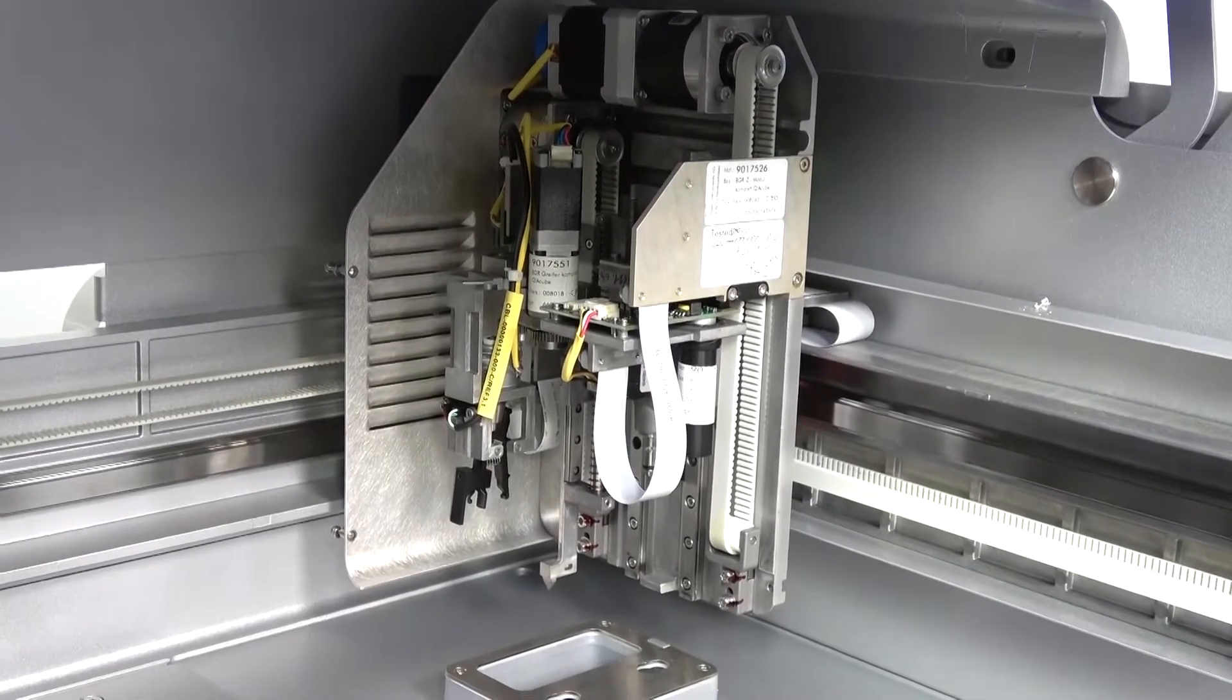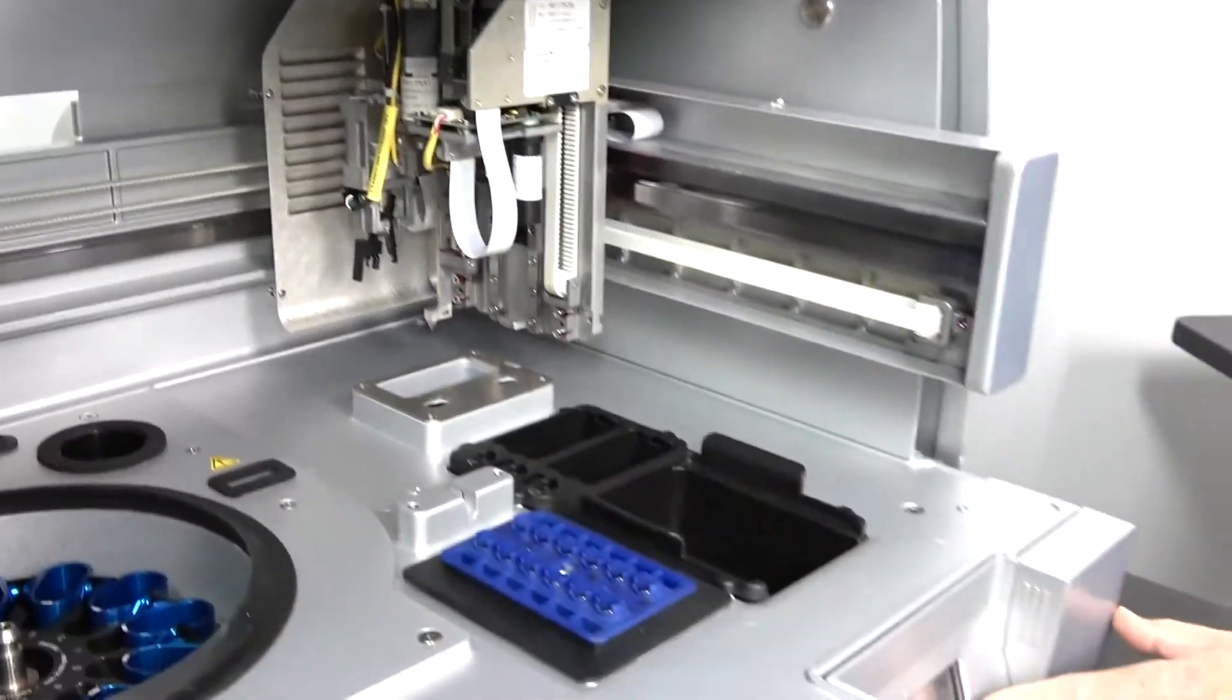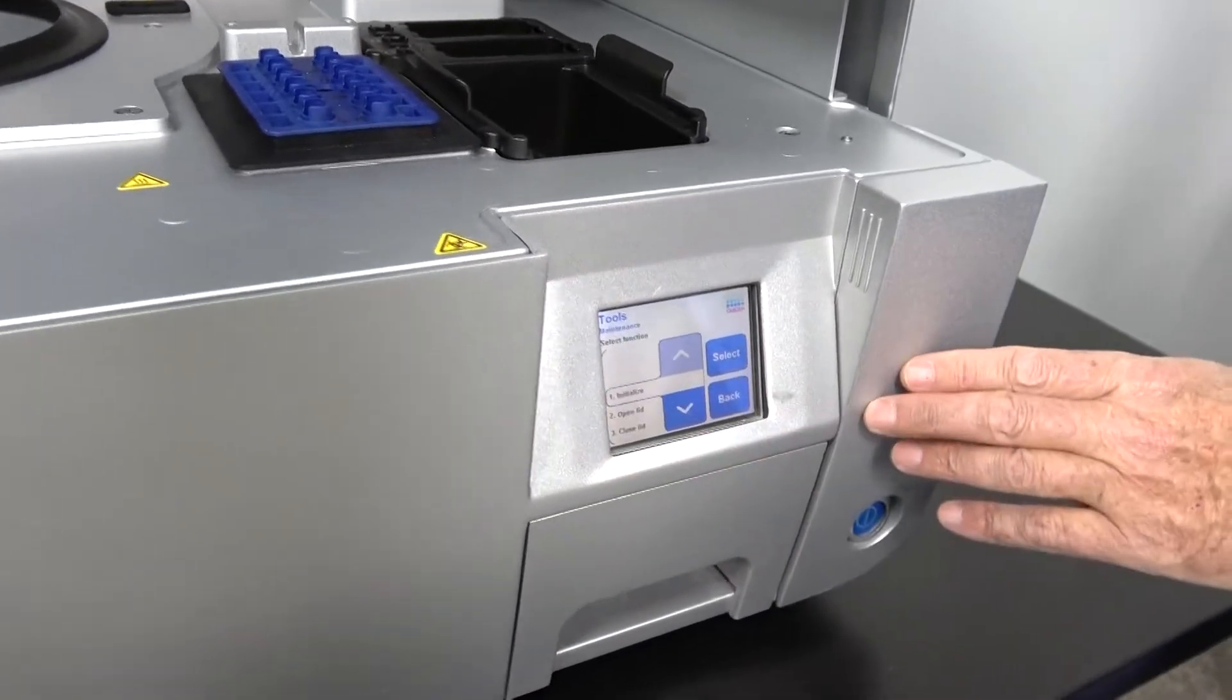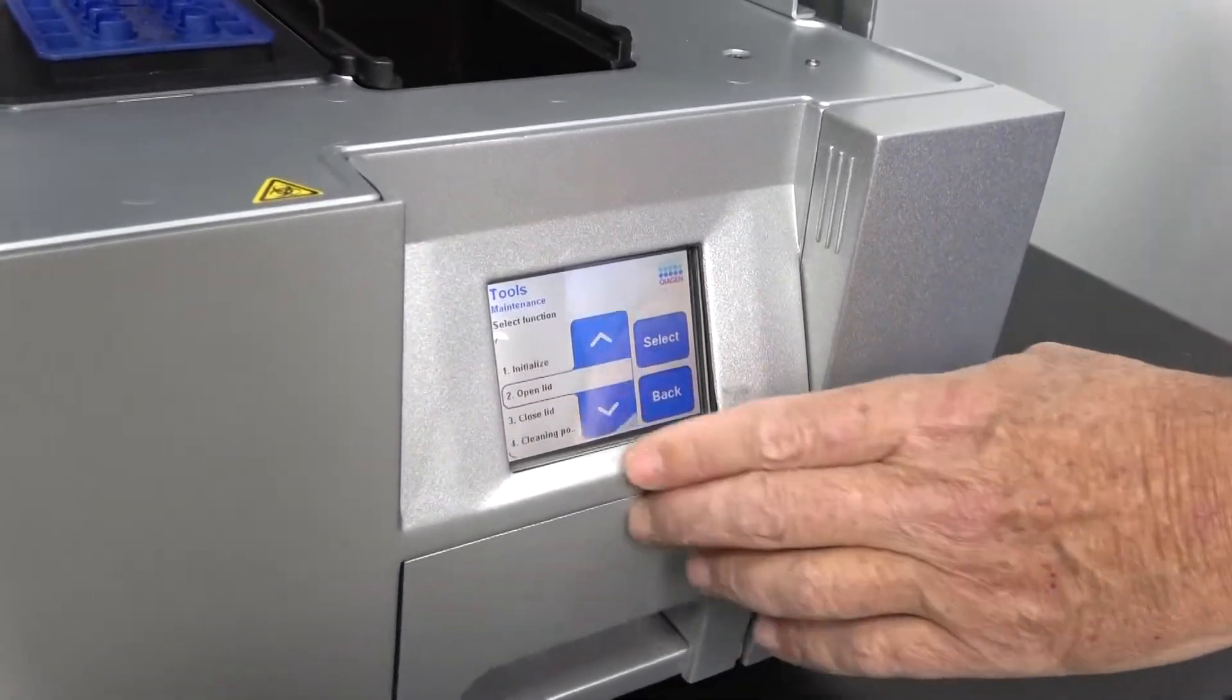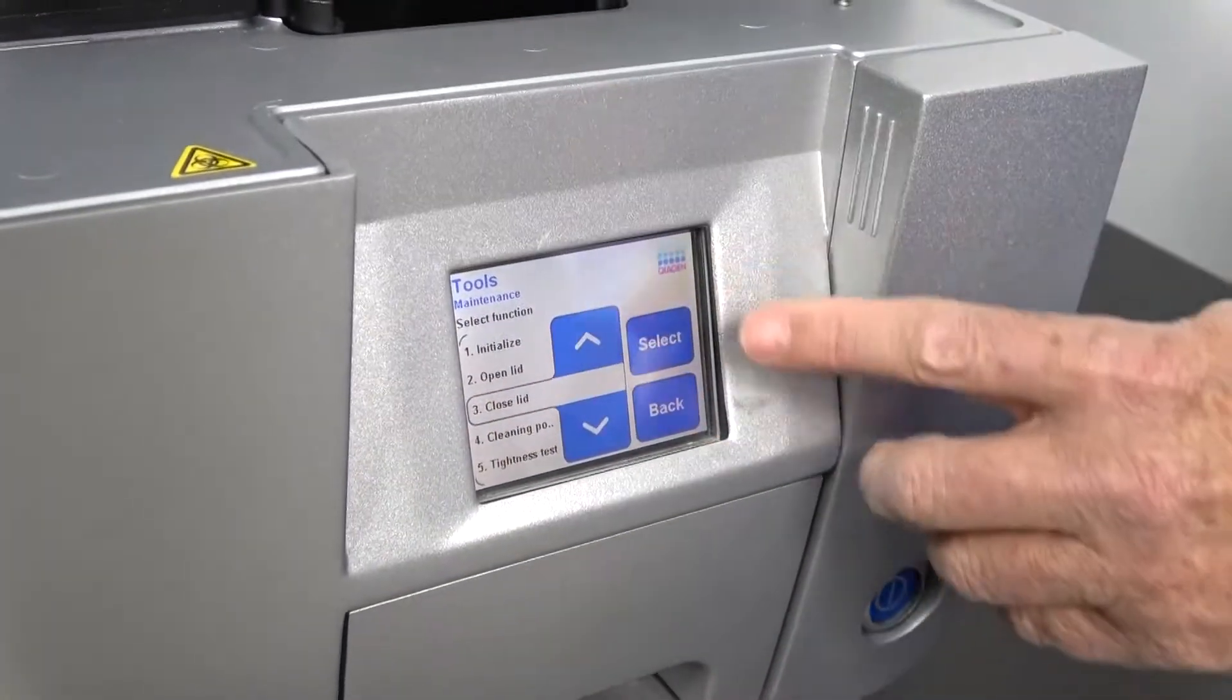Now it's ready to run. Then we could go into the initialization screen where we can go down to tell it to, for example, close the lid.